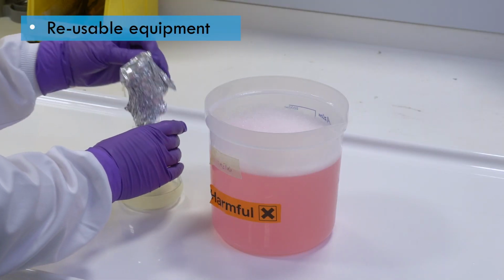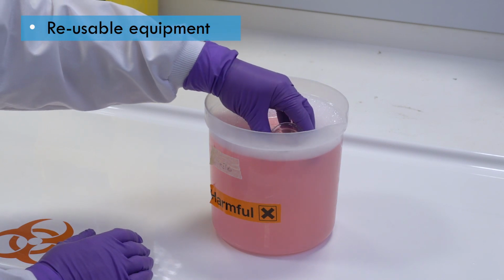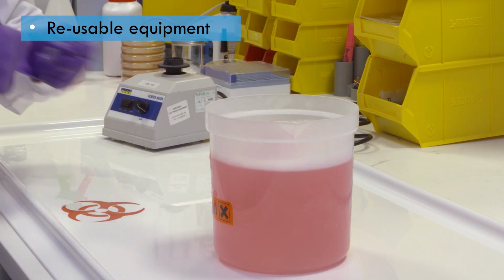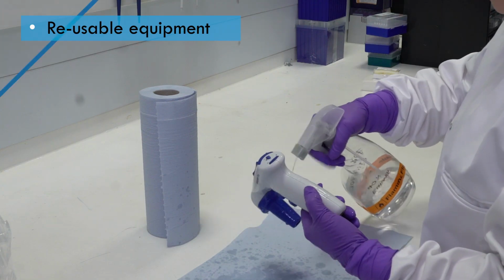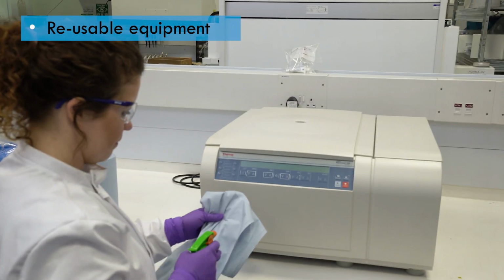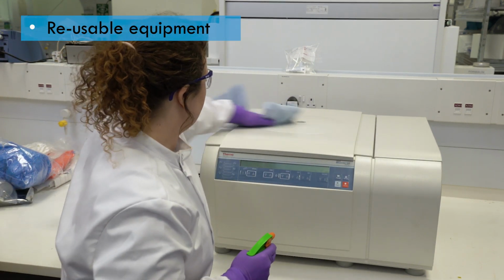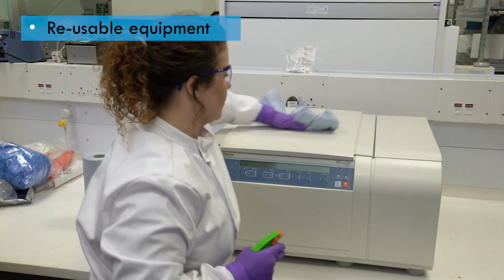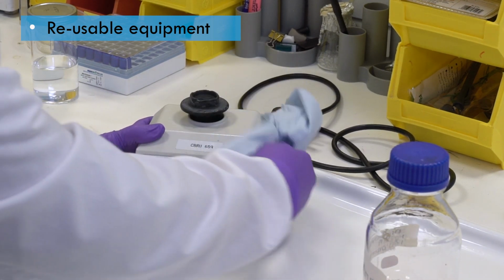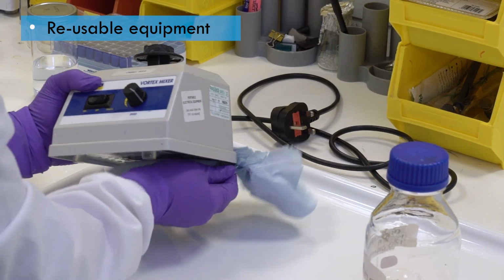It is important to decontaminate reusable equipment such as glassware before it is washed and reused. Glassware may be fully immersed in disinfectant. Other equipment, such as pipettes, will need to be wiped down. Exterior casings of equipment can be wiped down, but decontaminating interior surfaces may require special procedures, which we'll look at later. If the disinfectant leaves any residue, the equipment will need to be washed or wiped down with clean, sterile water.